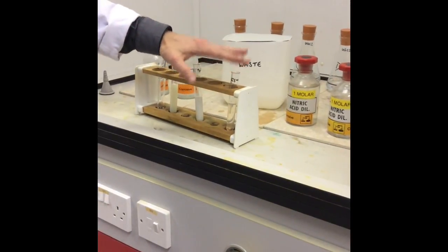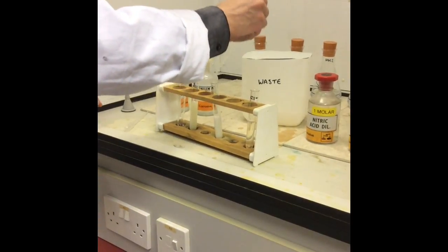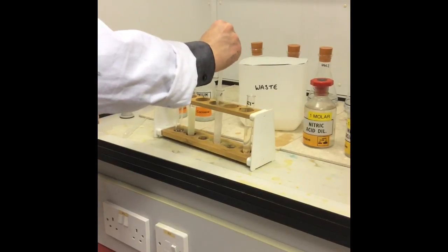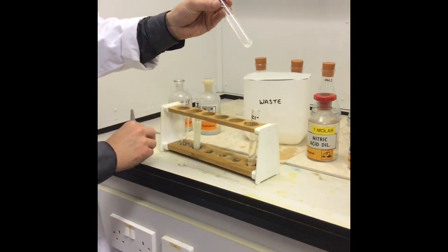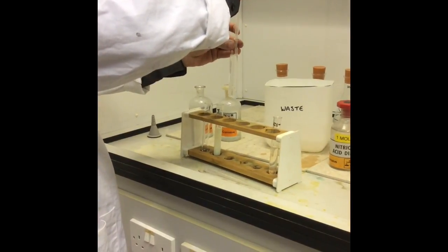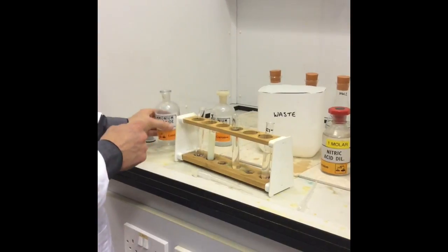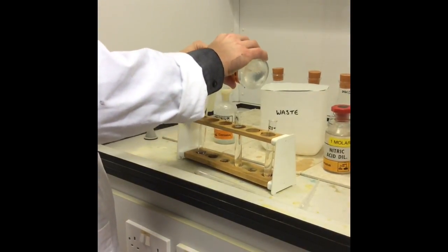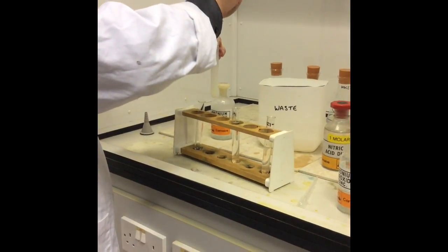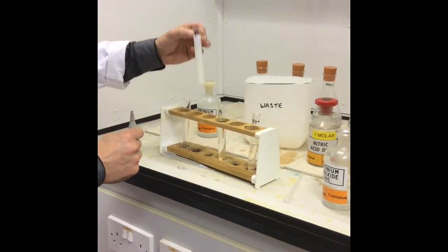Our silver chloride dissolved in dilute, so we don't need to worry about that. We're now going to see whether my silver bromide dissolves in concentrated ammonia solution. A couple of squirts of concentrated ammonia solution — it's definitely going, it's almost gone. Let's put another squirt in to make sure. And that has dissolved. So my silver bromide will dissolve in concentrated ammonia. What about my silver iodide? That doesn't look like it's dissolving. So the silver iodide will not dissolve in concentrated ammonia solution.